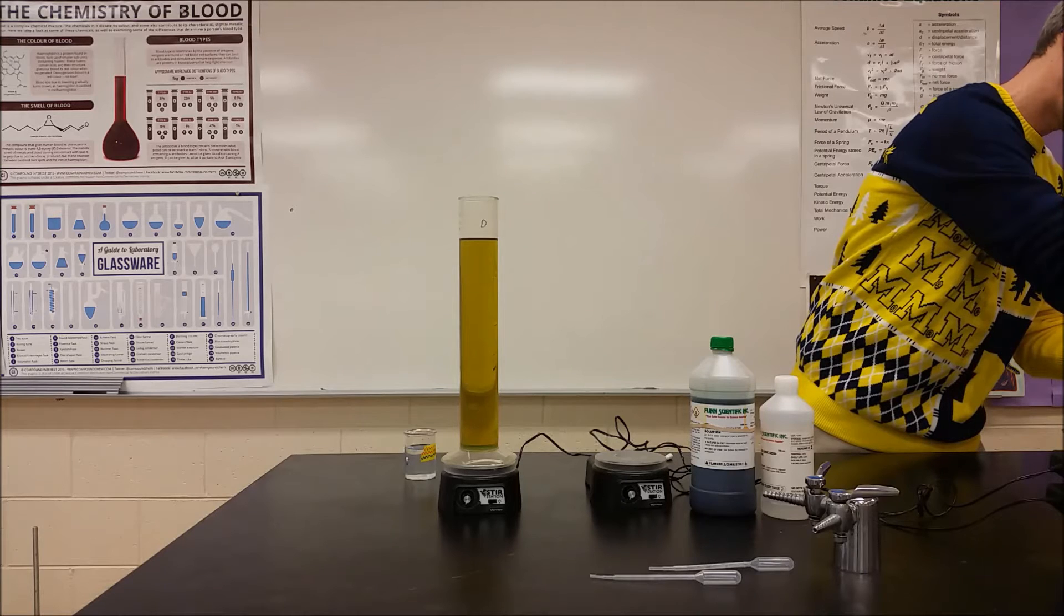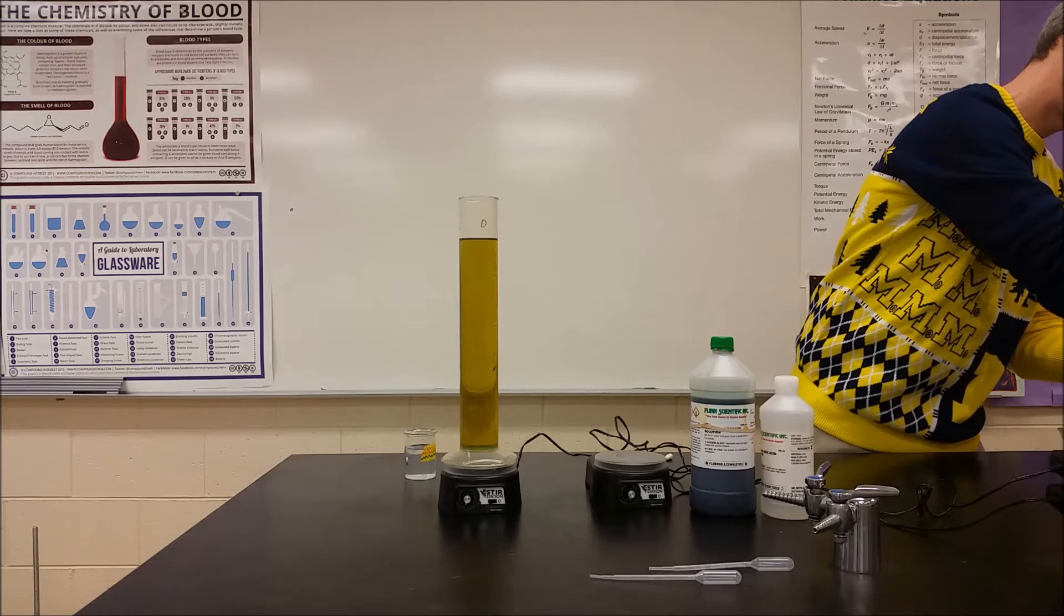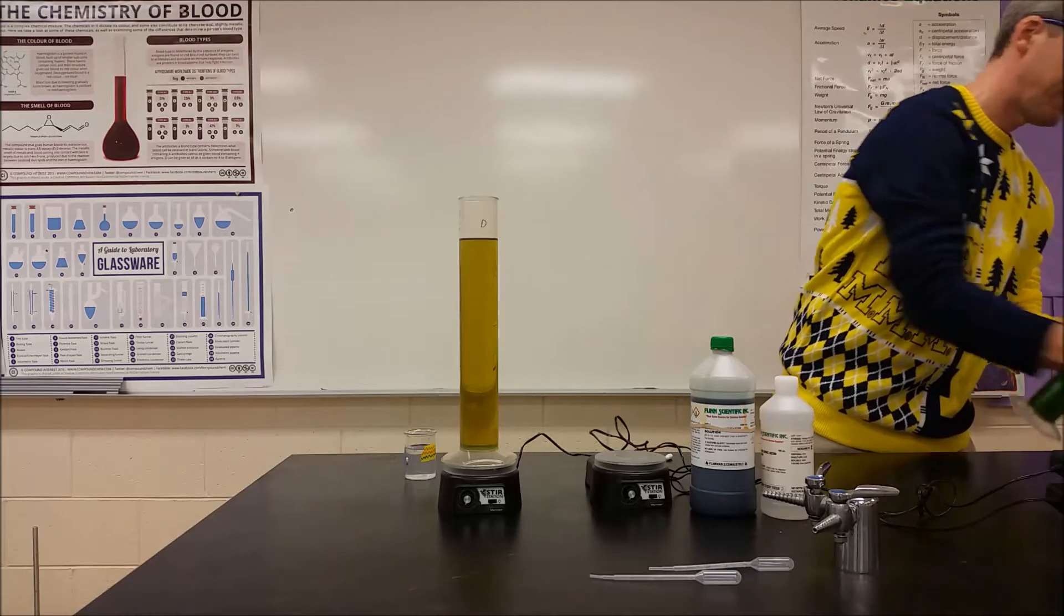And we're going to look at, as we add acid to the two samples of water, how quickly they change pH. We're going to try and get about the same amount in both.